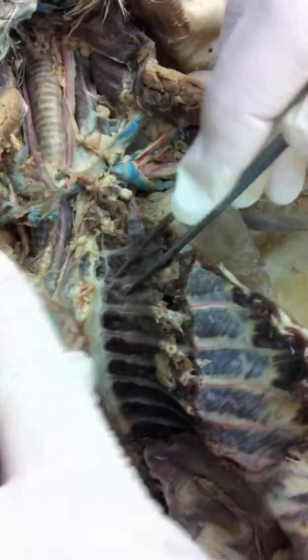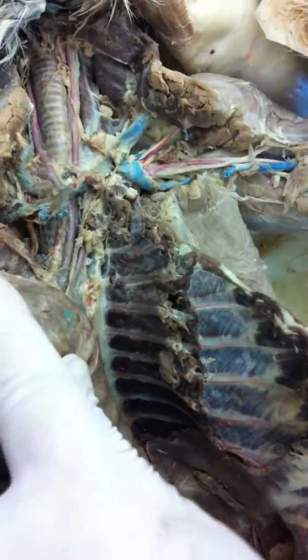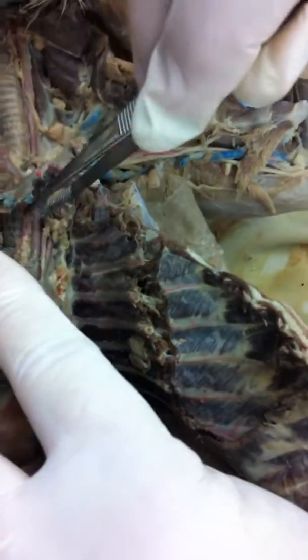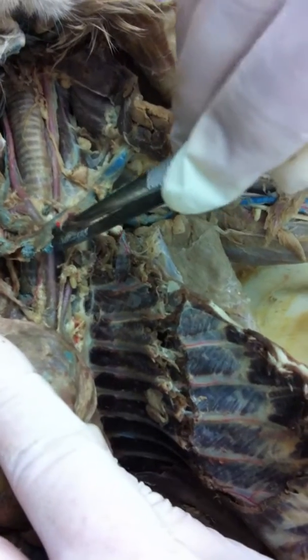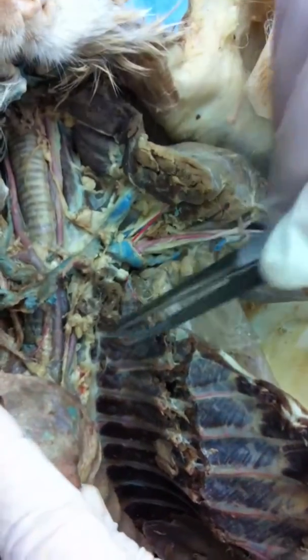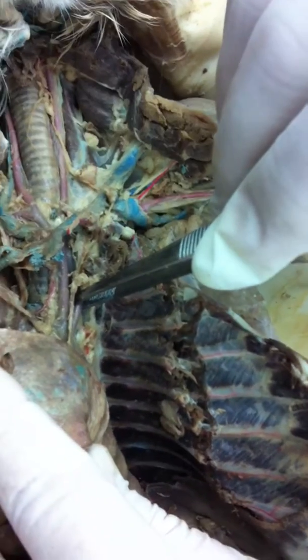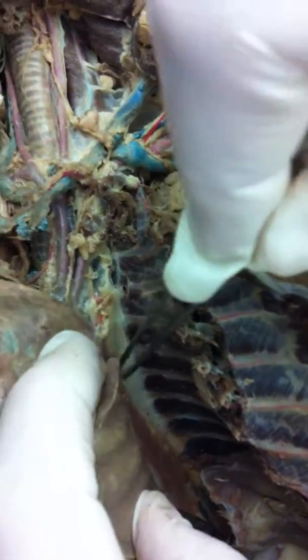All right, let's see what we can do a little bit deeper. Oh my gracious. I know what this is. Why would I tear it up? No, I said, when you said that, I said, did we tear it up? I thought I did. I know what this is. What is this? Brachiocephalic artery, right? What'd you tell me this was? Left subclavian. So what is this big vessel that they're branching off of that's running down through the chest?